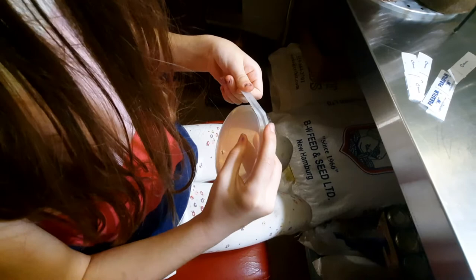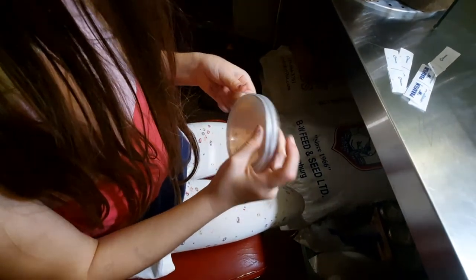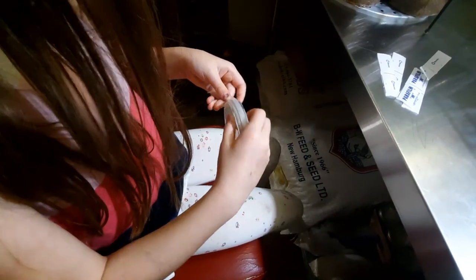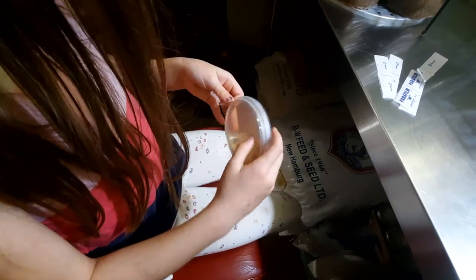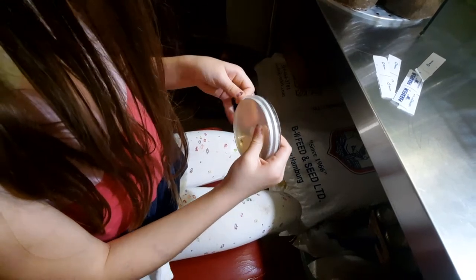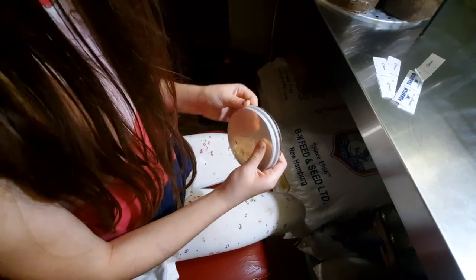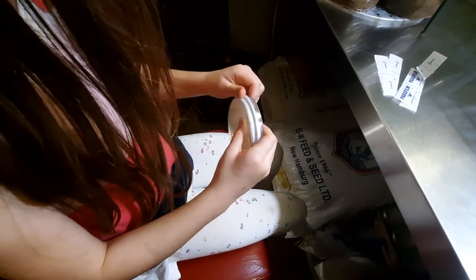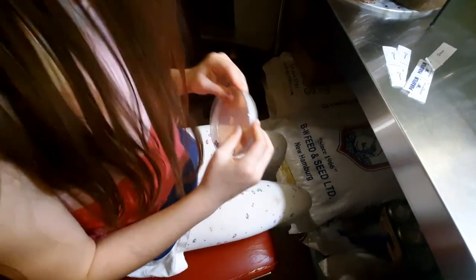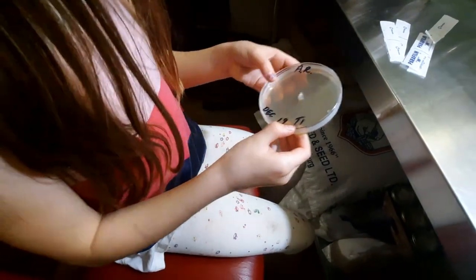Then keep stretching — hold and stretch and twist. And keep going. And tight. Because I need to make sure nothing gets out of it. And nothing gets into it. So the water doesn't evaporate.